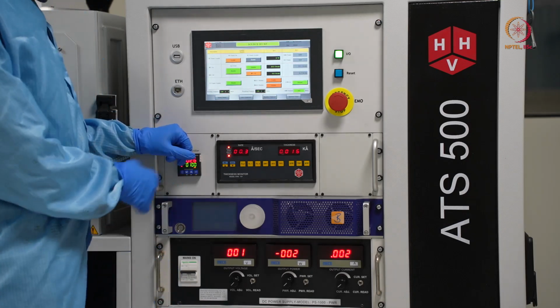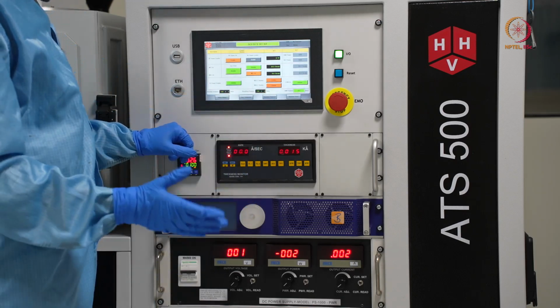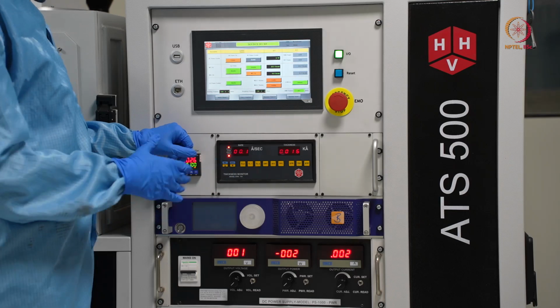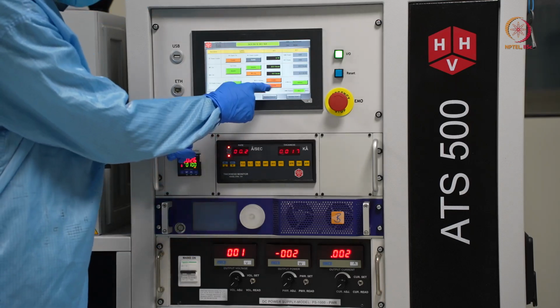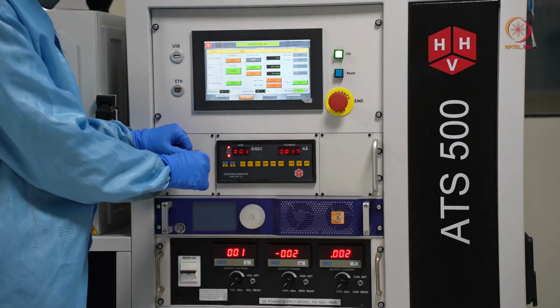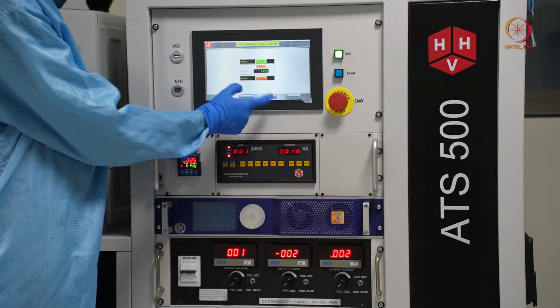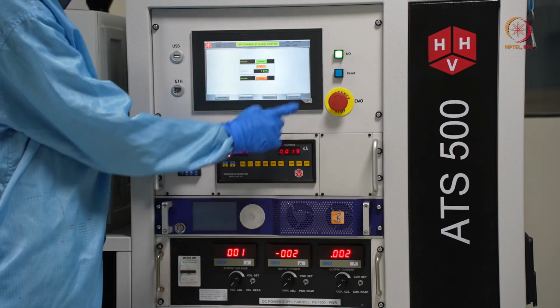Here, as we know, it is in magnetron 2, which we will come to later. Magnetron 2 is the right-side one that we have discussed already. We will open this for this deposition, and here you can see the ACC control. From here we can start the rotation, and we are going to do that. The rotation will be at 5 rpm, let us say.